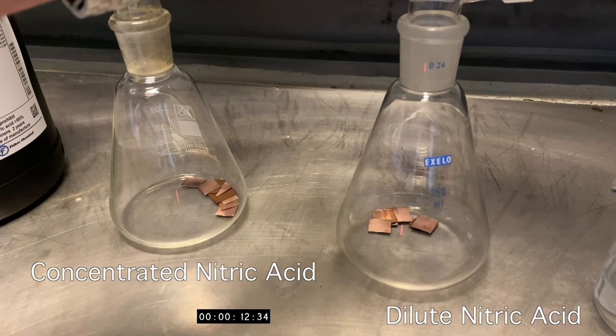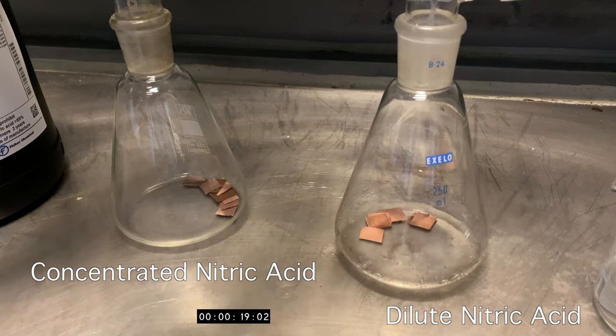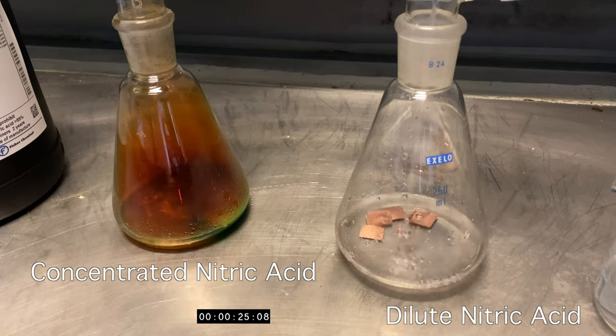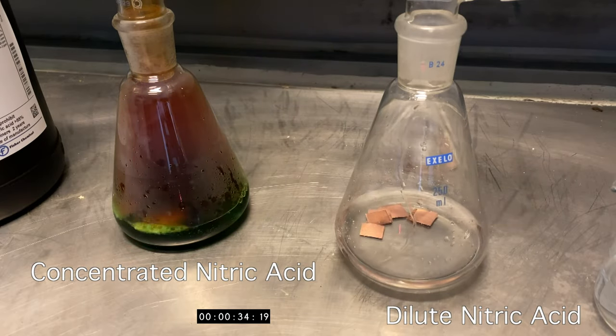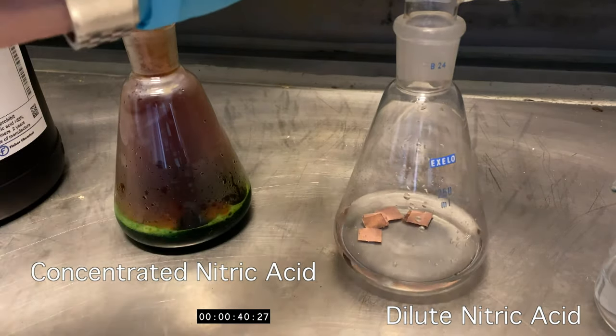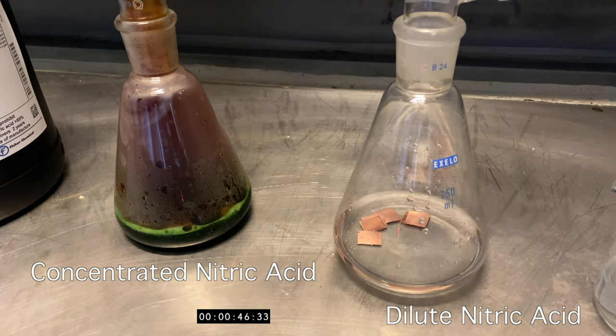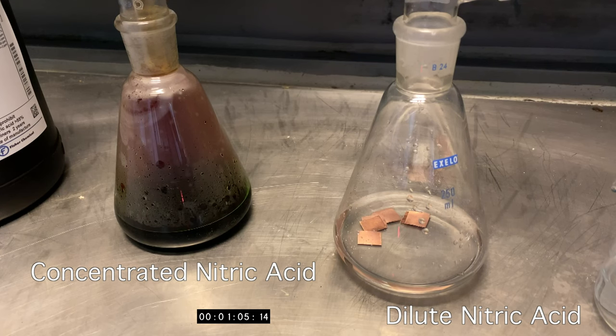If you watch, you'll see the concentrated reaction goes very quickly. Clouds of brown gas, which is the oxide NO2, nitrogen dioxide, and the solution goes a deep greenish color. Violent bubbling.